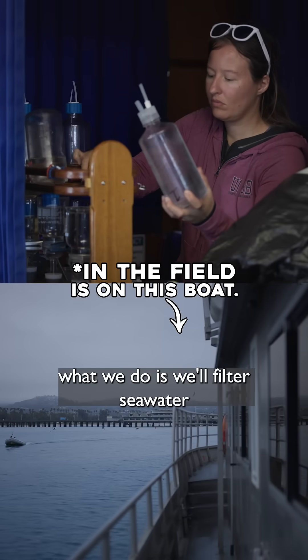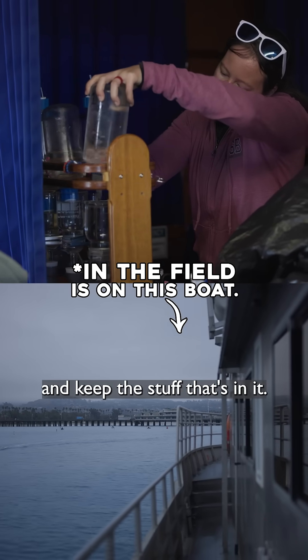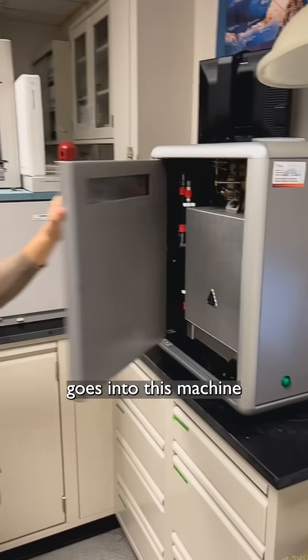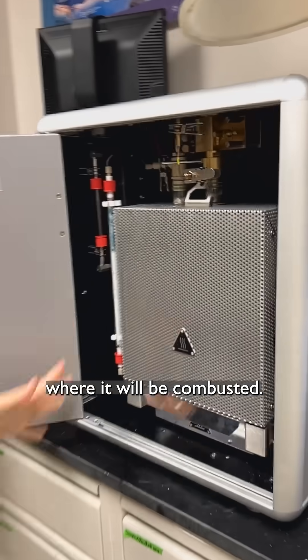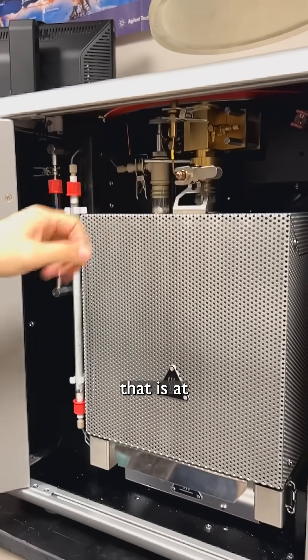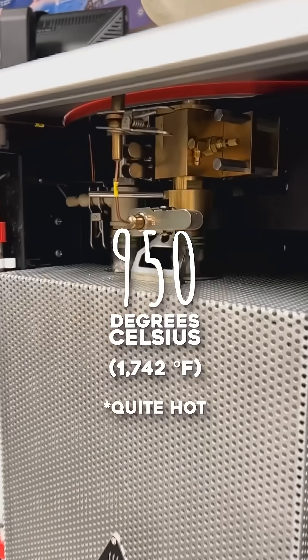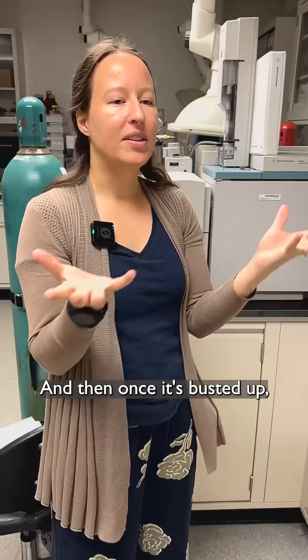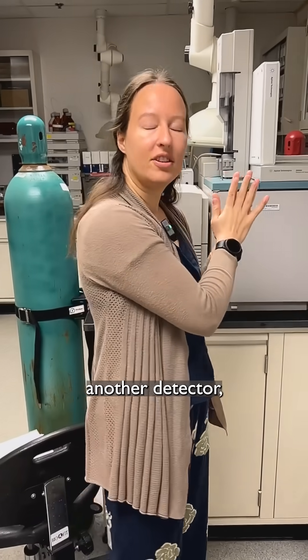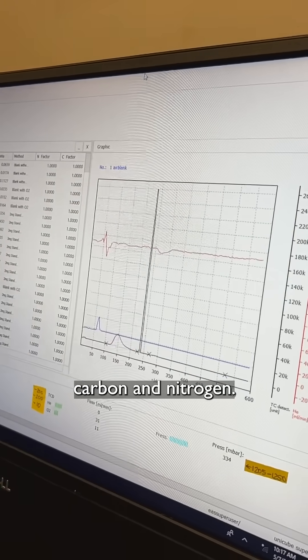In the field, we'll filter seawater to get rid of the water and keep the stuff that's in it, and then the filter goes into this machine where it will be combusted — burned in a tube at 950 degrees Celsius, so quite hot. Once it's combusted, all the gas that releases off gets pushed against a detector that will measure carbon and nitrogen.